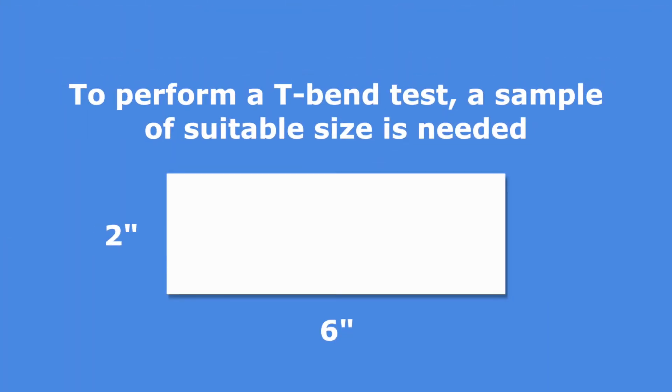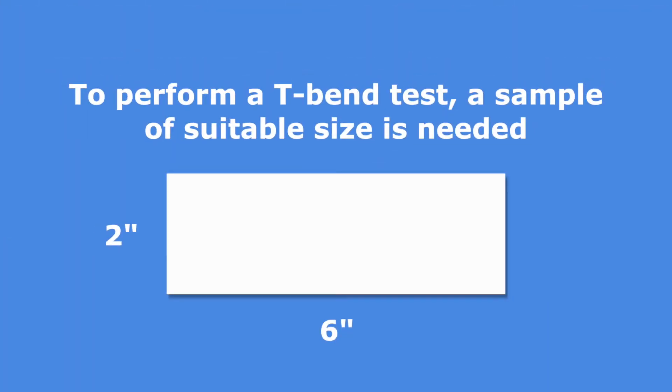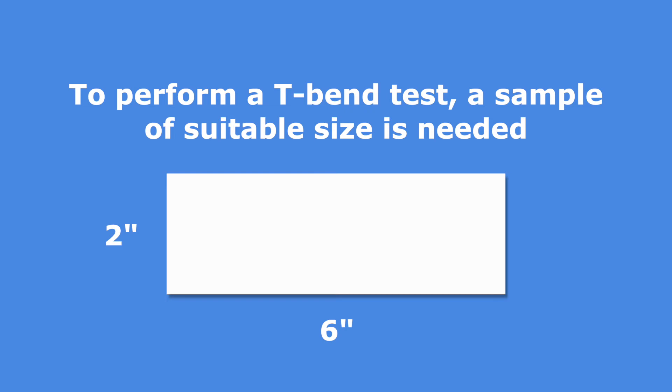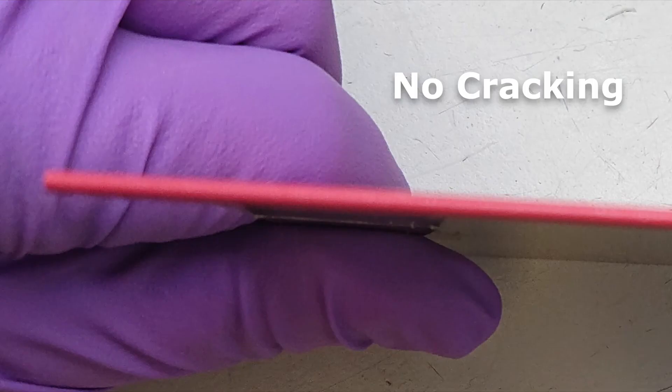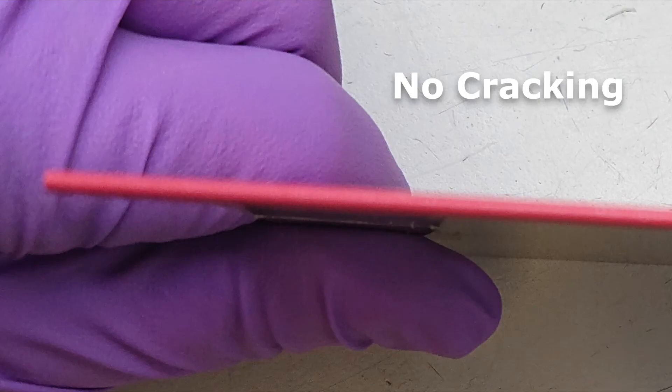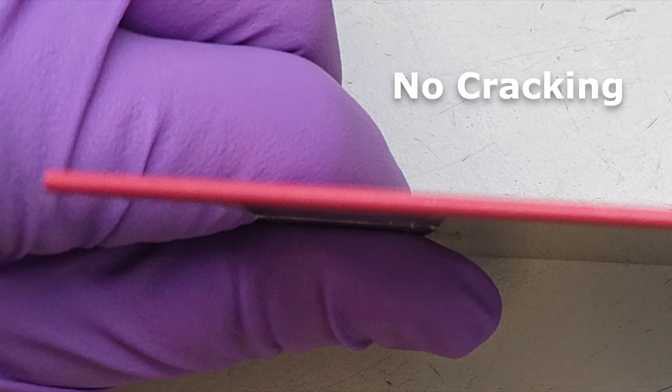In the building products industry, where the metallic coated steel is expected to provide the necessary corrosion protection, some amount of cracking of the coating is often acceptable. When performing a T-bend test, it is important to understand the bend direction relative to the rolling direction of the metal. In many cases, the bend is made along the rolling direction; in other cases, the bend may be specified transverse to the rolling direction, that is, against the grain. To perform a T-bend test, a sample of suitable size is needed. A 2-inch by 6-inch sample is a convenient size to work with. Once a bend is made and crimped, it is common practice to inspect the bend for signs of cracking of the coating. Where no cracking is important, it will be specified at a particular T-bend for those applications.